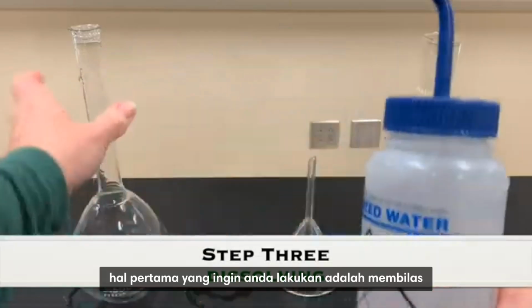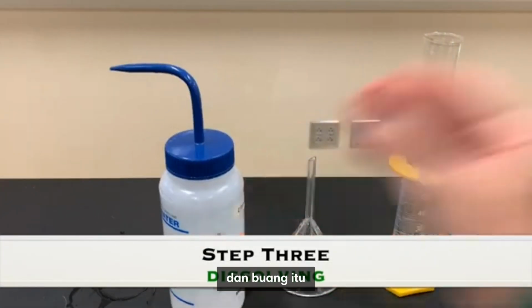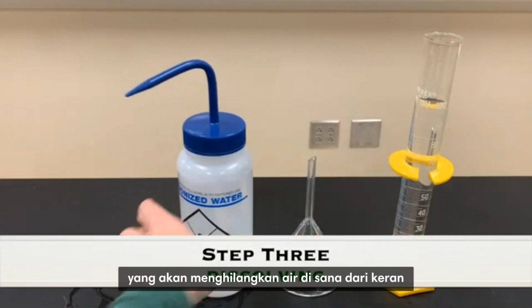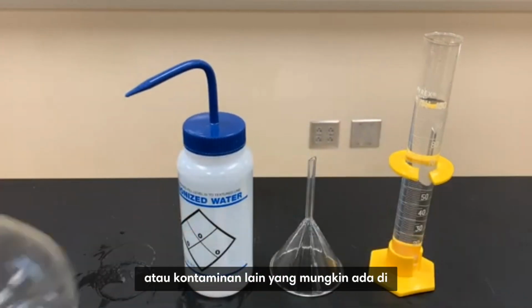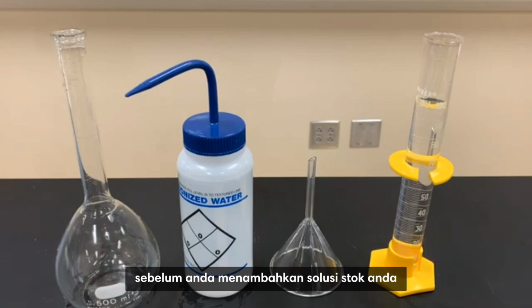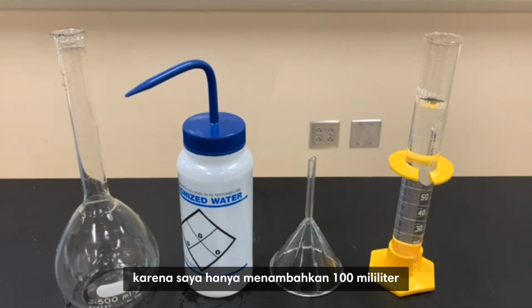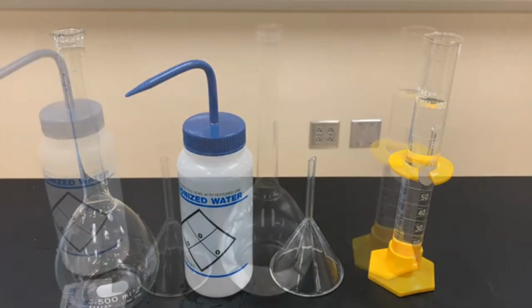The first thing you'll want to do is rinse your volumetric flask with distilled water and dump that out. That way you'll remove any water from the tap or any other contaminants that might be in the volumetric flask. Next, fill some of the volumetric flask before you add your stock solution. In this case, I will add it about 1/2 full because I'm only adding 100 milliliters.